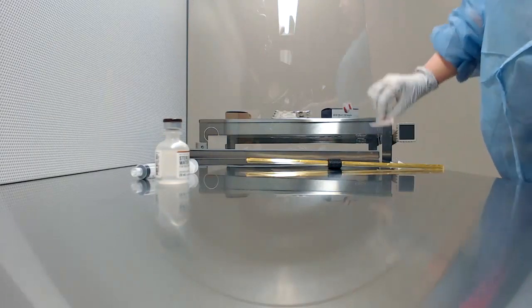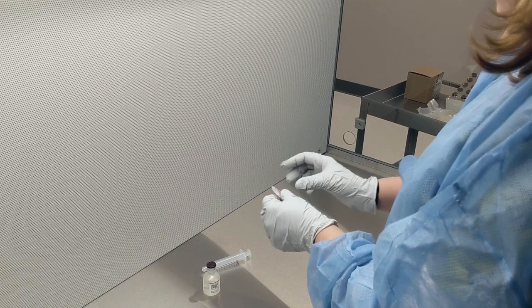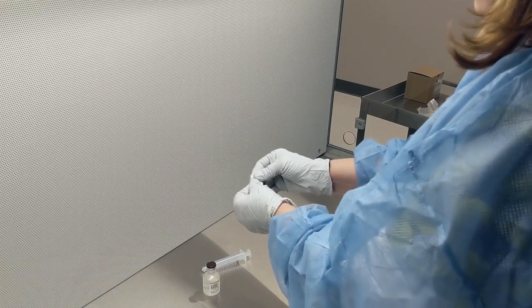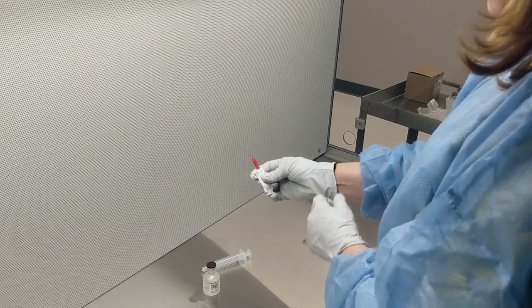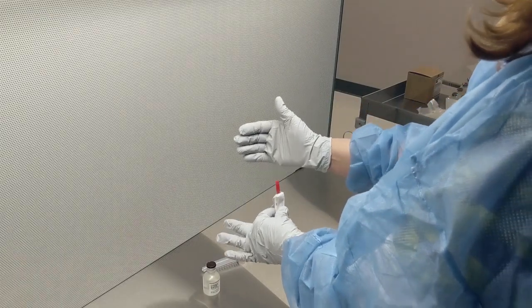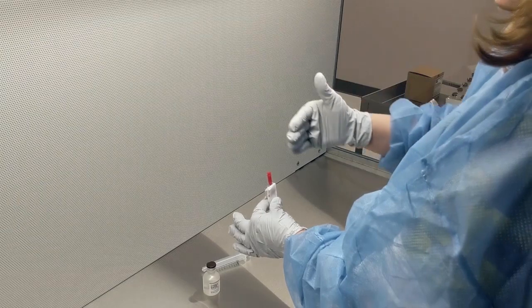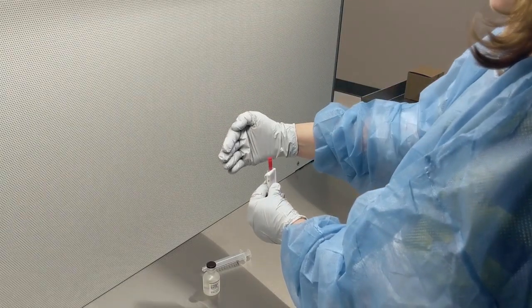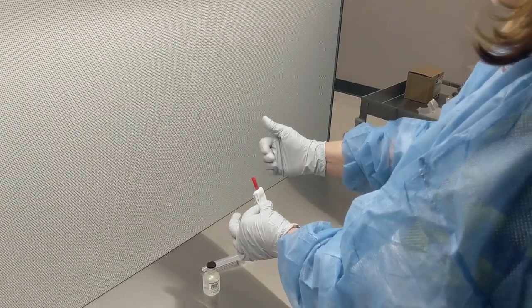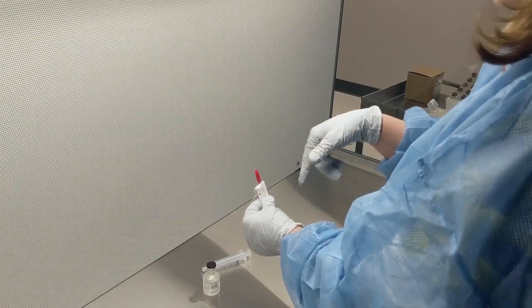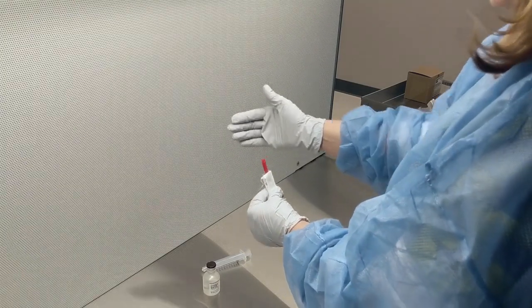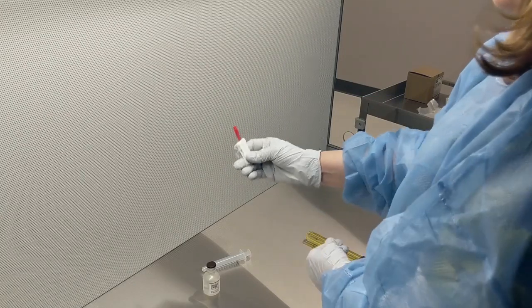Next, I need to put the needle on the syringe. Again, I don't want this wrapper in that area, so I'm going to open it up at the end where the wrapper comes apart. This is all sterile. Now you have to be careful—this is where the hand technique comes into play. The air is flowing towards you. You don't want to put your hand behind the needle or the syringe because that'll block the flow of air, and possibly you can get contaminants, dust, and things in your preparation. Be careful not to block the flow of air.